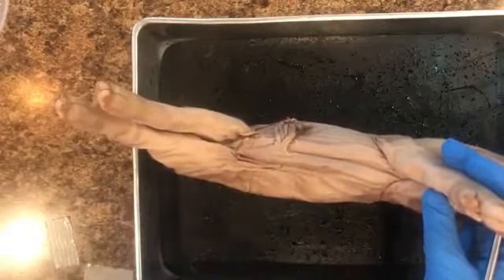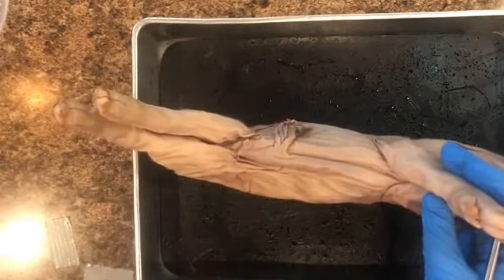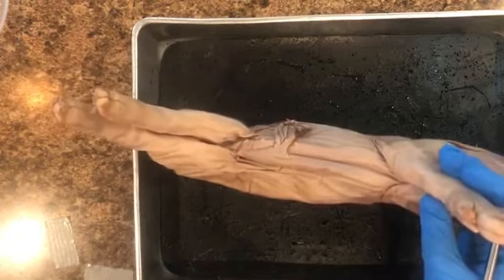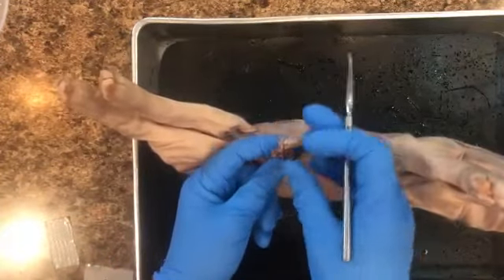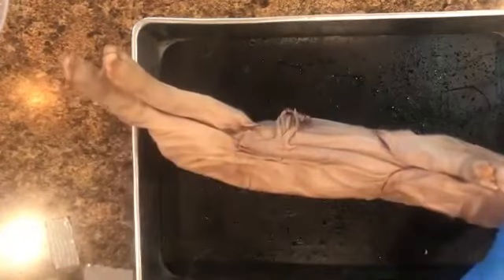So within the umbilical cord, there are two arteries. There's a larger and flattened umbilical vein, and then a very round and small allantoic sac, which is part of the extension of the urinary bladder in this fetus. So like I said, there are two arteries and a flattened vein. Based off of this, it's a little bit hard to tell.